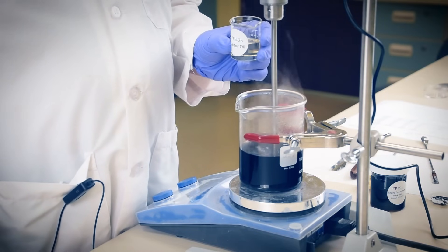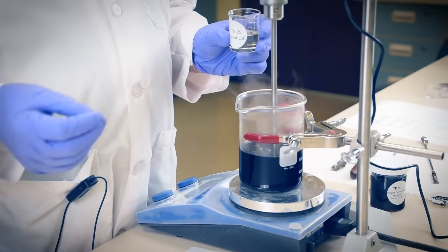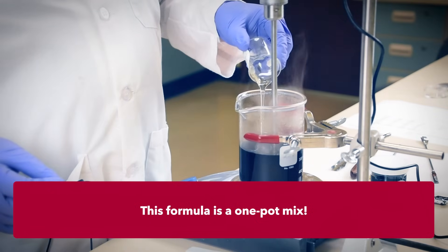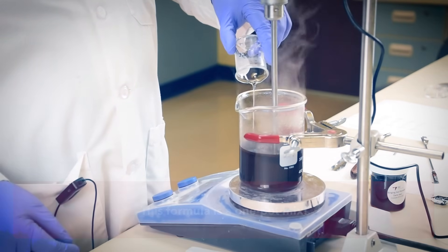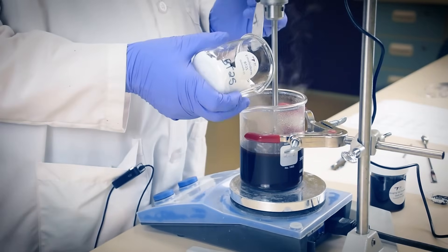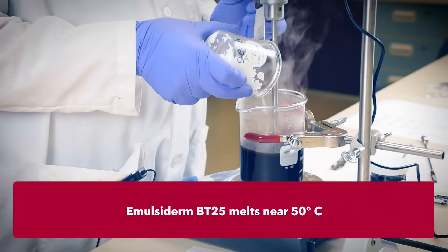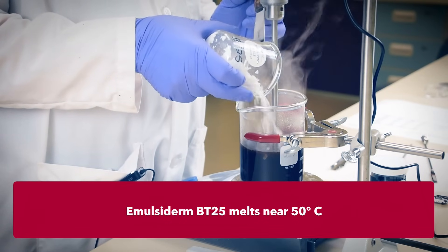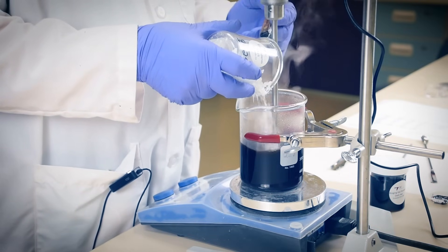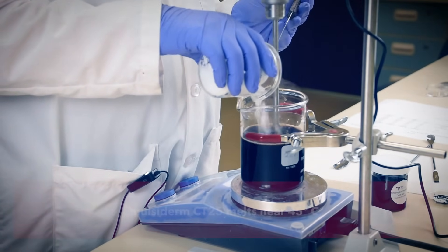Our solution is at 85 degrees Celsius. We've added our phenoxy-based preservative already. So now add the three surfactants in situ and in order — a one-pot batch process beginning with the liquid PEG ester. This lowers the overall surface tension, which helps the next two wax materials disperse easier upon melting into the mix. Maintain the high temperature. We'll now slowly add the BT25, which has the higher melt point of the two alkyl ethers. Allow it to be melted and dispersed before continuing.